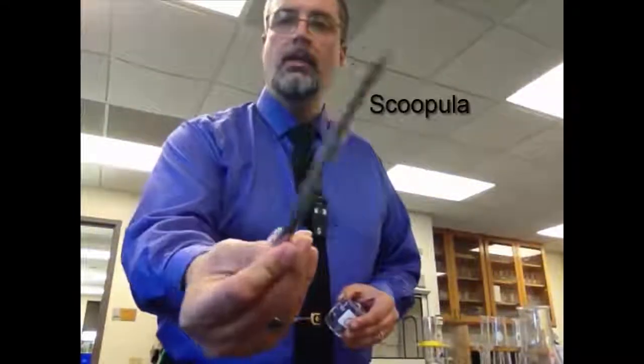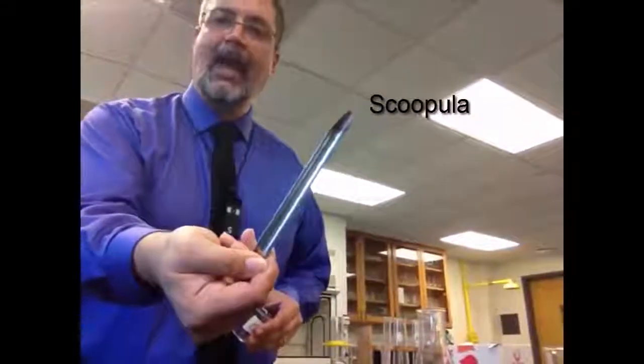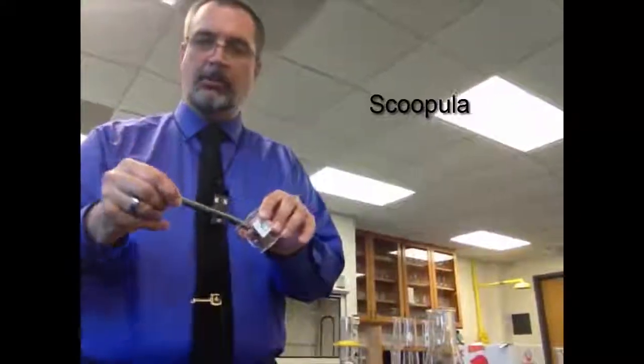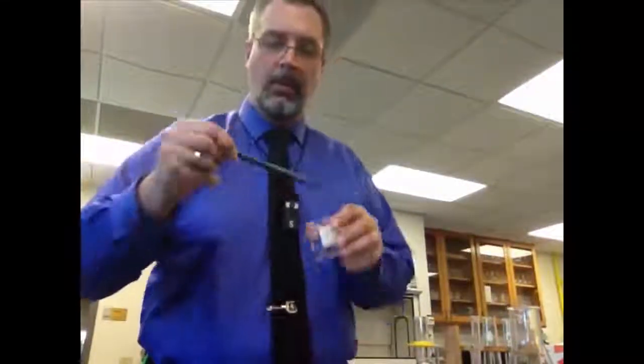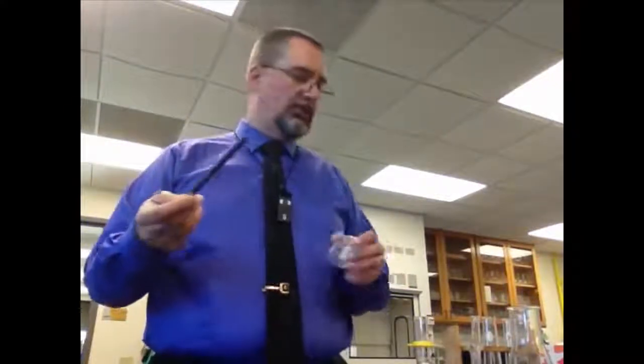Just a couple more to do, a couple of other pieces of equipment that you're going to be using that you want to become familiar with. Anytime you need to take some powders or crystals out of a beaker, for example, or out of a bottle, you're going to use this thing. This is called a scoopula. It's like half scoop, half spatula. And so you can reach in and you can grab some, and it sort of sits right in there. It's like a little spoon. It sits in there, and you can transfer it from one place to another. So this scoopula is used to get solid powders or crystals out of bottles or beakers and put them someplace where you want to use them.